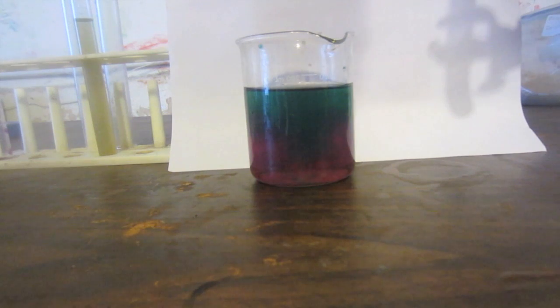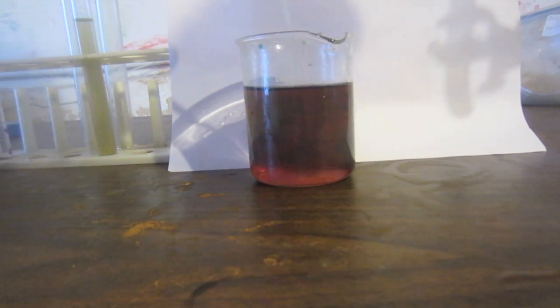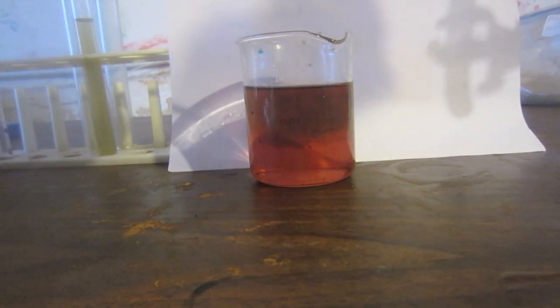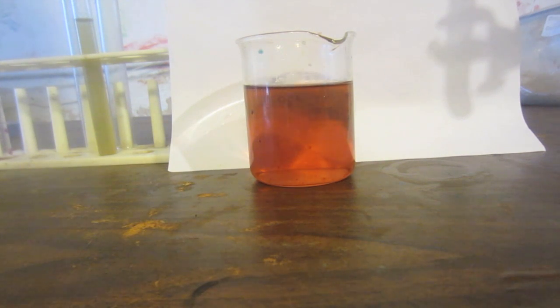There already you can see there is a hint of purple in the new color, and there is now some brownish pink. Some of the manganate reverted to permanganate, which is why you see purple. A lot of it decomposed into various oxides of manganese such as manganese dioxide, and that's why you see a kind of layer of a precipitate there—an insoluble precipitate. The reason you don't see very much is because the colors of the other compounds are extremely intense and this solution is actually extremely dilute, but there is a slight precipitate. So that's what happens when you add acid to the manganate ion.